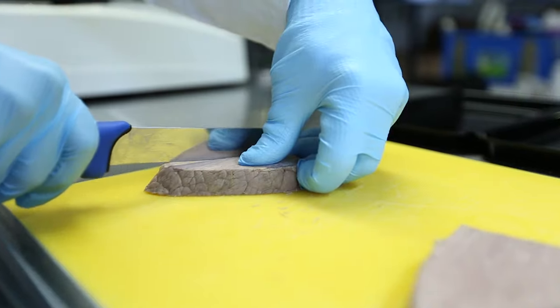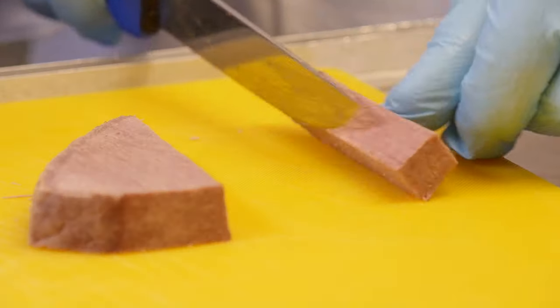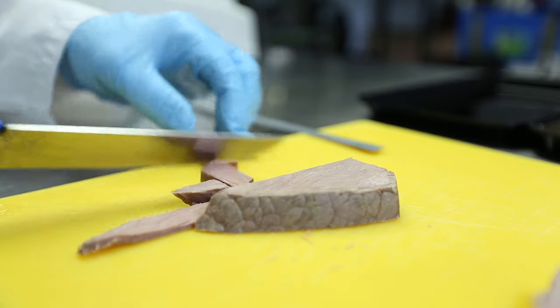Cores can be round or cubed. Cubed cores are easily repeatable and commonly used. Eight to ten cores should be enough to show eating quality through tenderness.